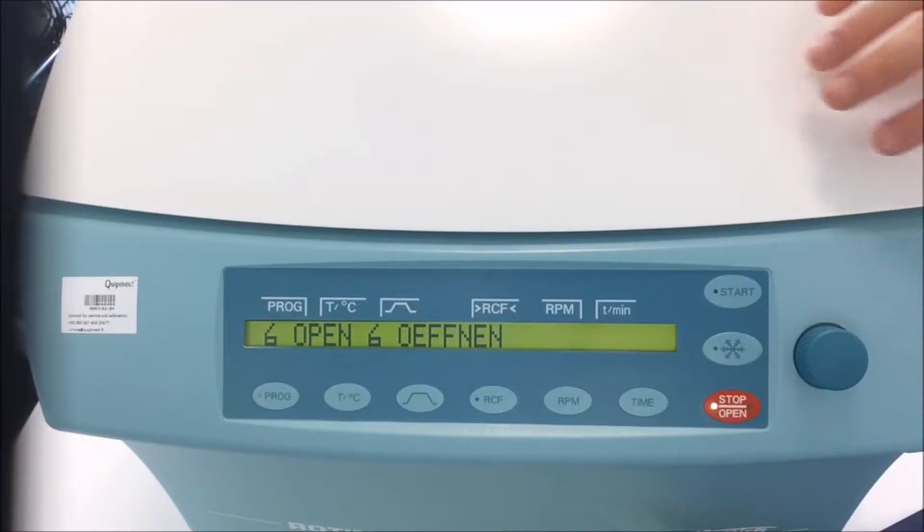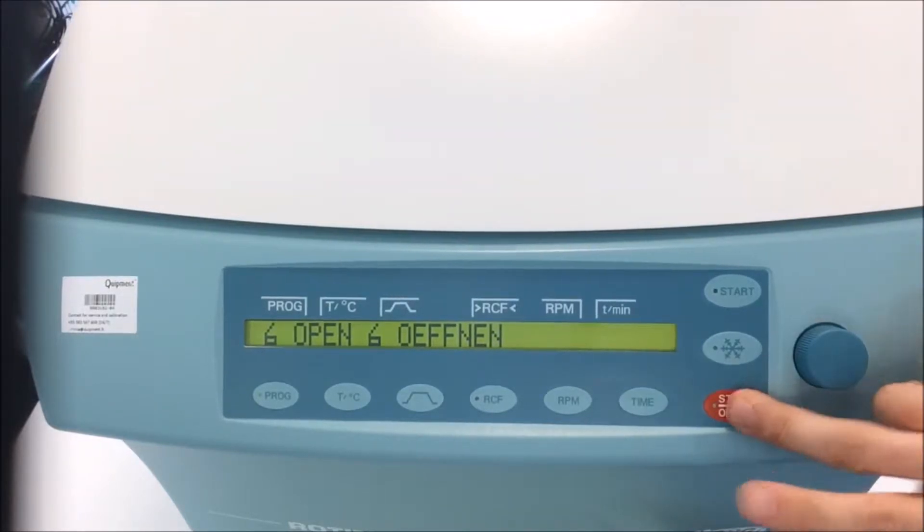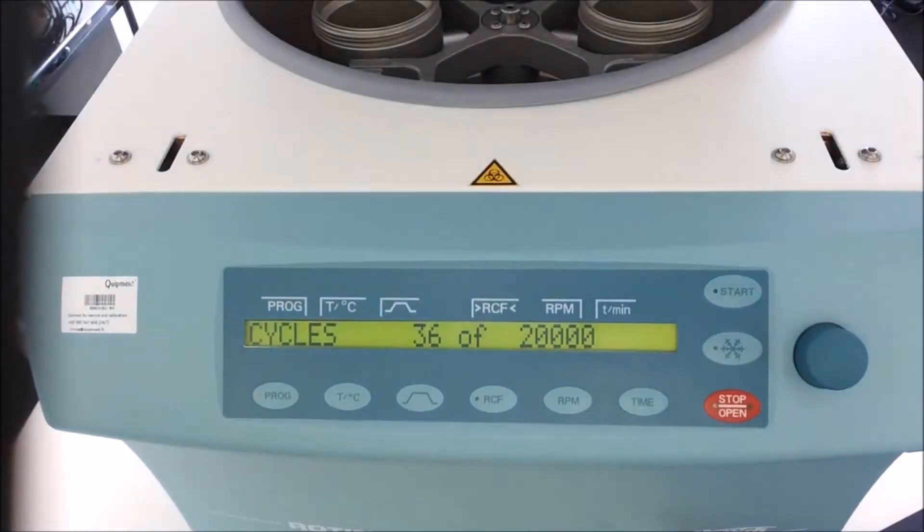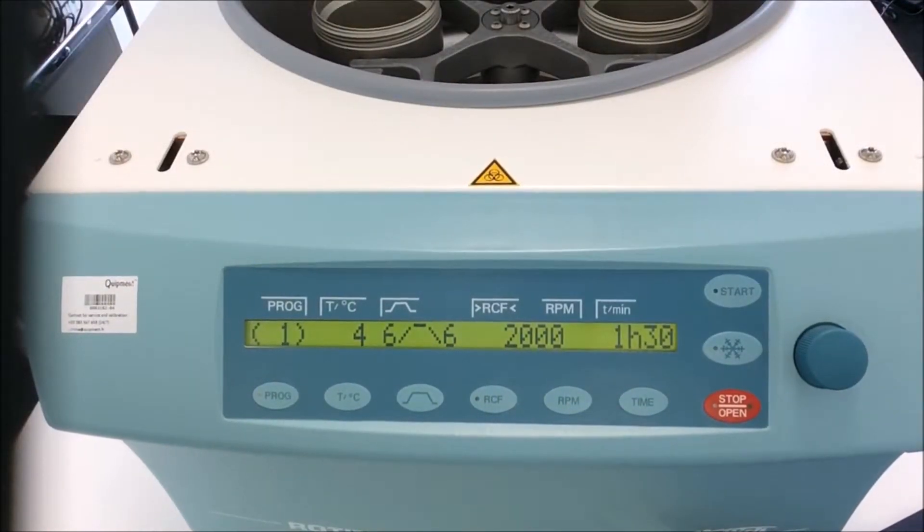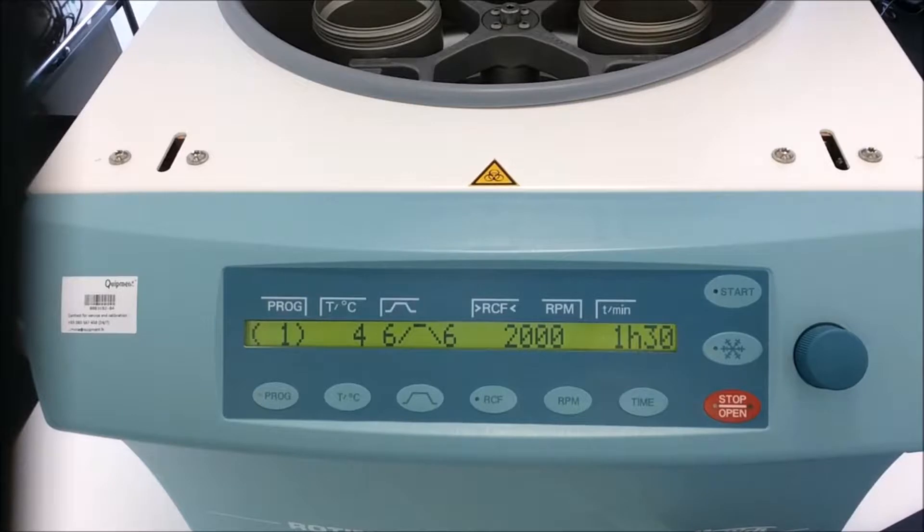Now I can open the door of the centrifuge using open key, and I have access to the chamber.